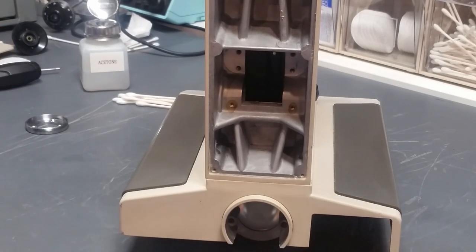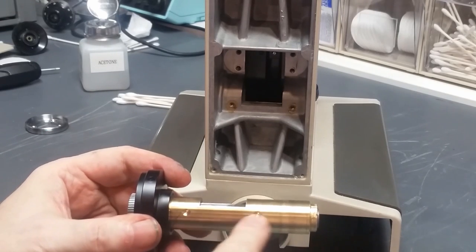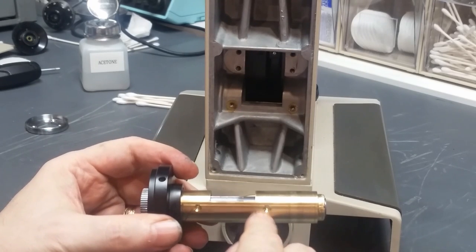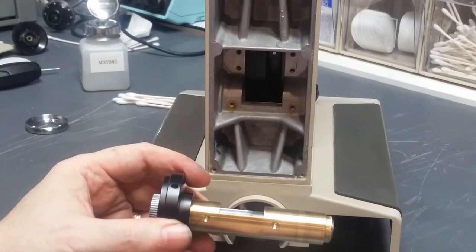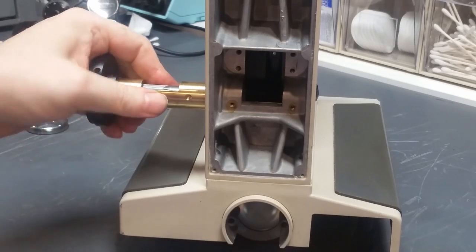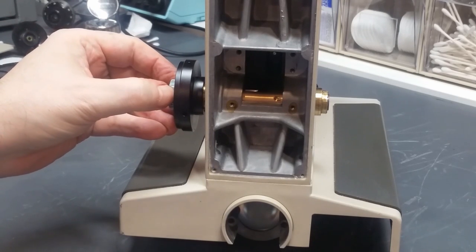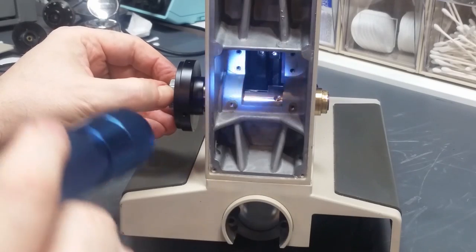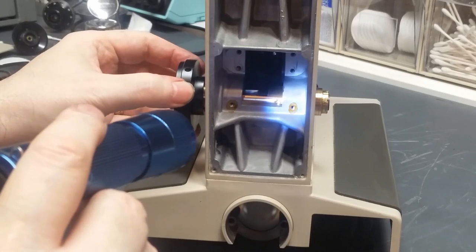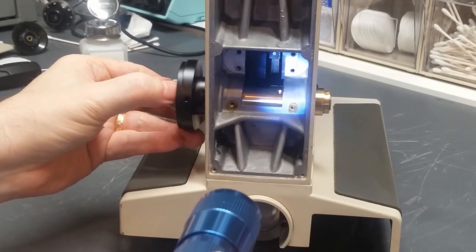Now, this pinion assembly has two depressions drilled into it. These line up with these two set screw holes, so that when the set screws go in, they bottom out in these depressions, and that automatically aligns this thing so that it's perfectly aligned for all the gears to mesh and so forth. So what I do is I slide this guy in. Maybe I can light this up so you can see it a little better. There's the depression, there's the set screw hole, and what I want to do is try to line those up. And if I look in through the holes until I see them, I should be able to get a perfect alignment.